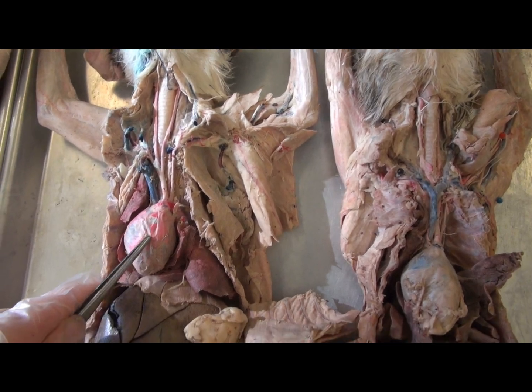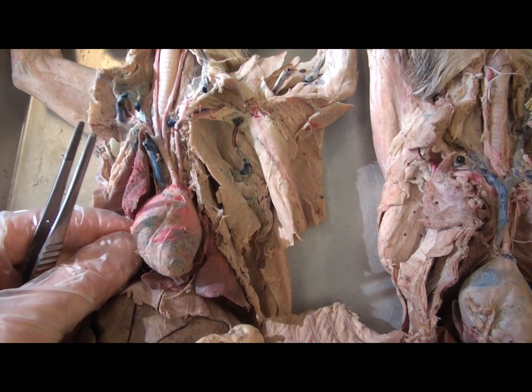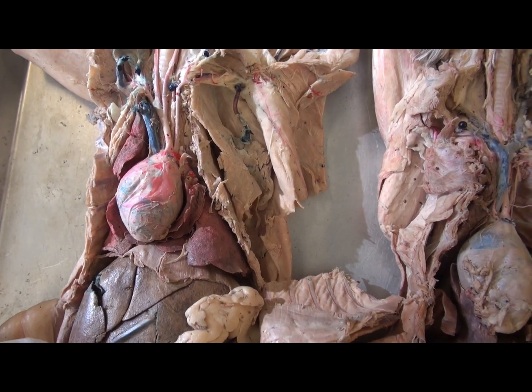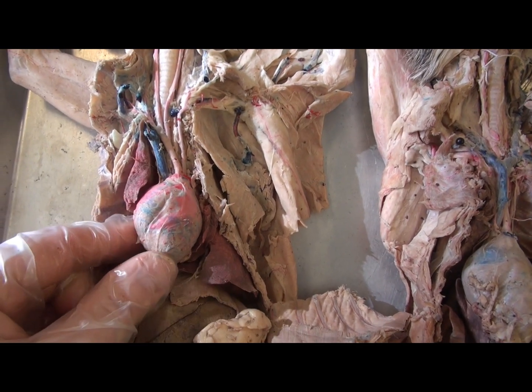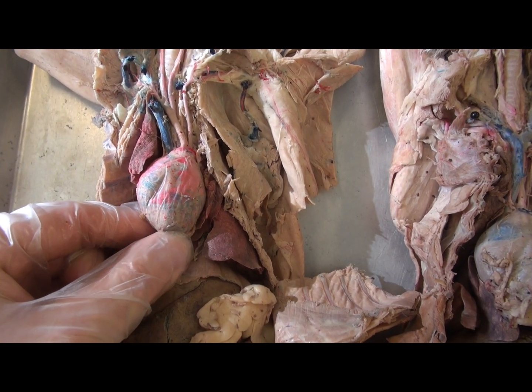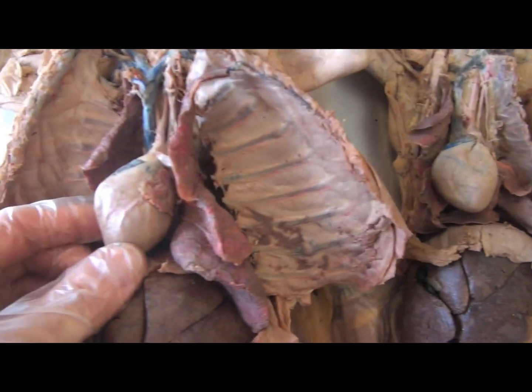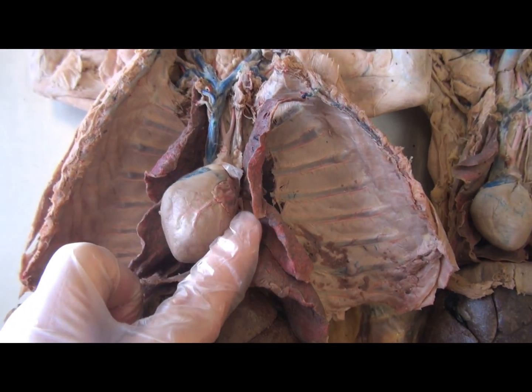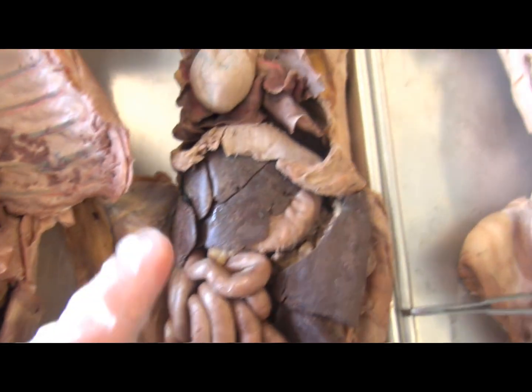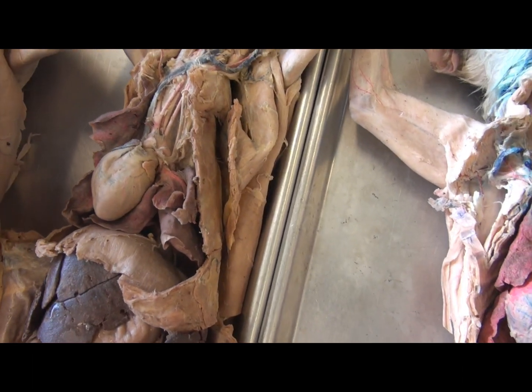Notice that once one removes the ribs, at first there is the parietal pericardium which surrounds the heart. This is a serous membrane which helps it move without developing blisters and adhesions to the surrounding lungs. Once the parietal pericardium is removed, one can observe the outer surface of the heart — the epicardium — which is also part of this serous membrane, its visceral layer.